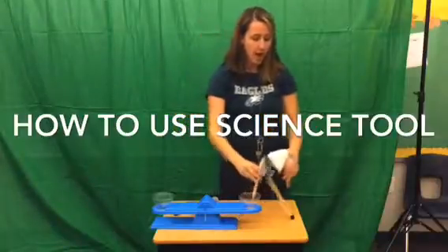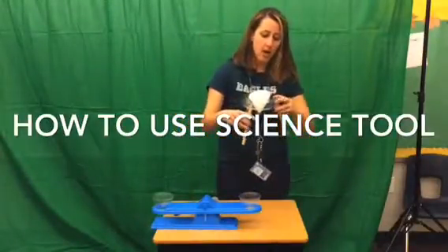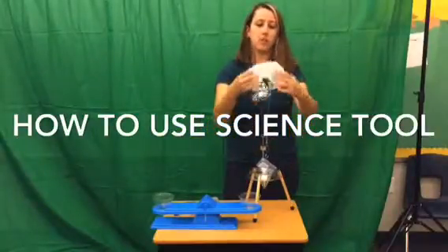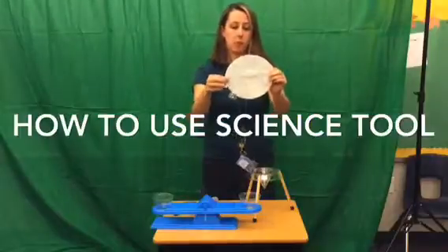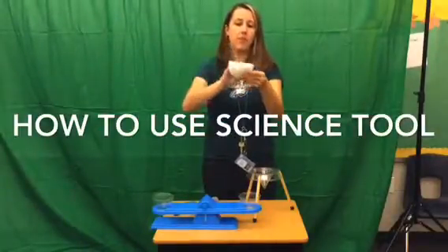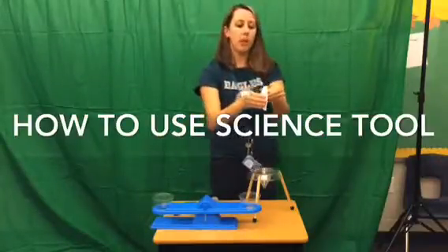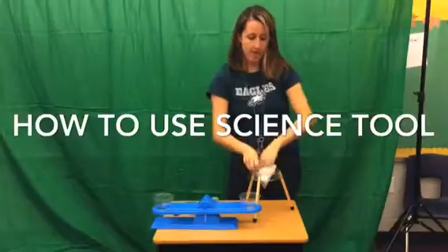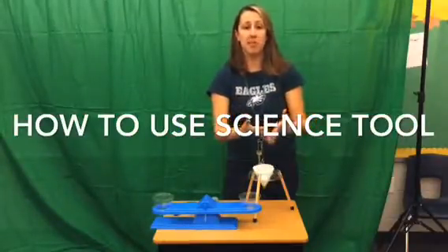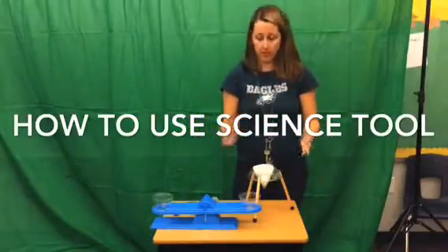So first of all, here I have, this thing always falls off. It's a funnel, and we use these filter papers to funnel different mixtures and solutions. So when I have a filter paper like this, it's just a coffee filter, you're going to fold it in half, then fold it again so I have quarters. And when you open it slightly, you have then a filter that if we put a mixture in, it might filter some of the things that are in that mixture so that we can separate the multiple things.